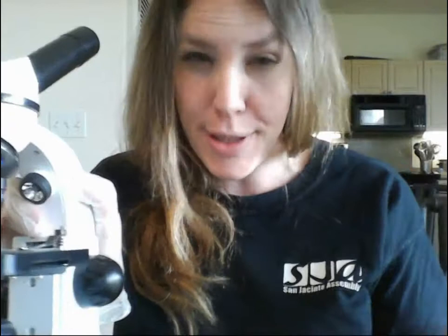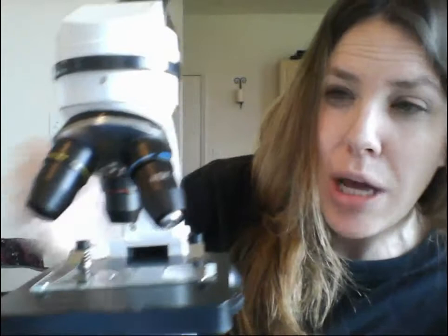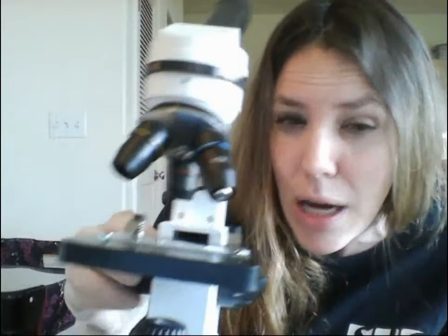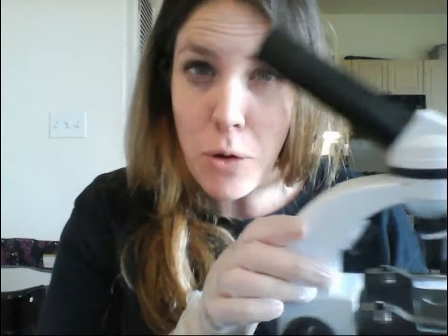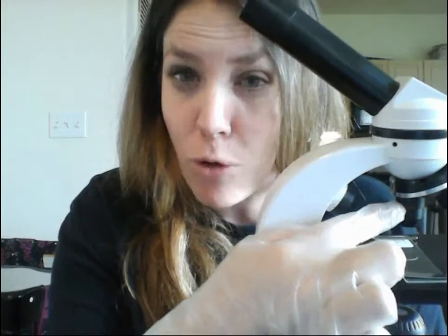With our slide on here, notice there's a large distance between the specimen and the bottom of the objective lens. You're going to want to bring that stage close to the lowest magnification objective. Here's the important thing: no matter what specimen you're focusing, always start with the very lowest magnification — the 4x, the red one. Focus it as perfectly as you can, then switch clockwise to the 10x, focus that, and then finally to the 40x.